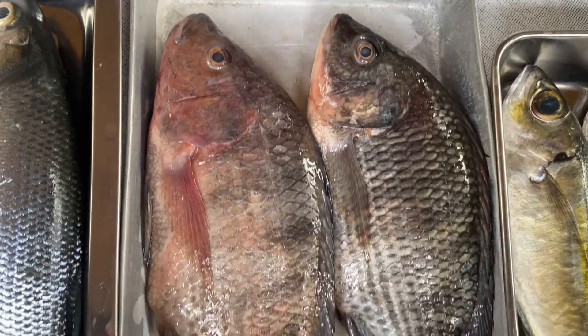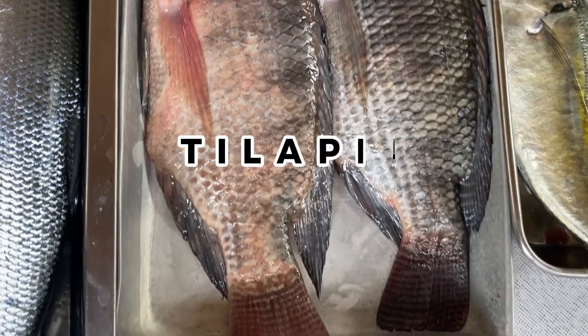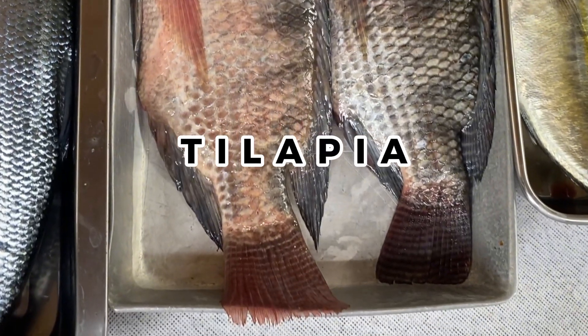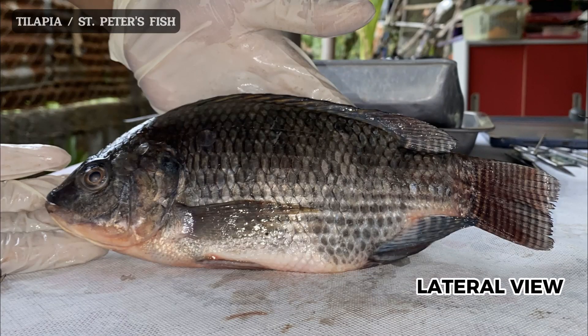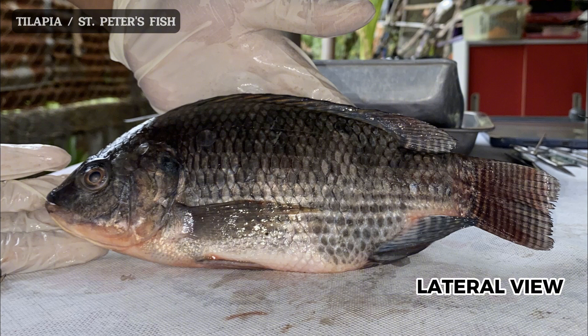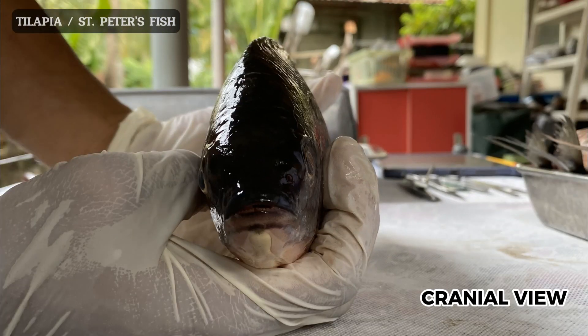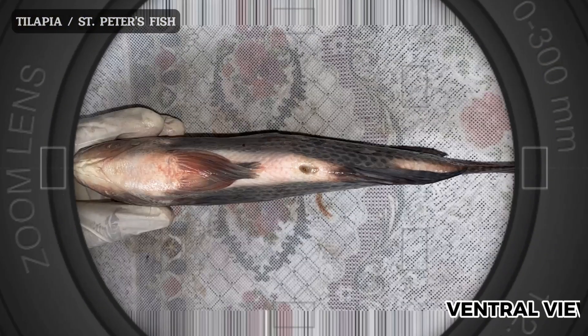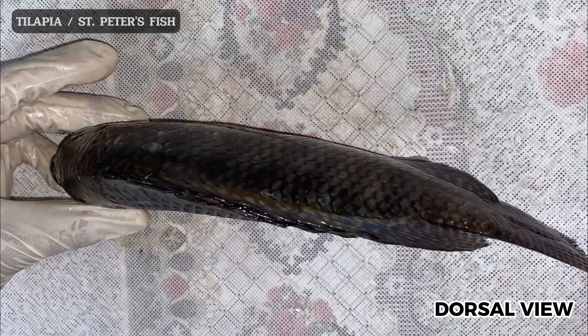For the next part, we will use the tilapia, also known as St. Peter's fish, as the model. First, we will view it in lateral view, then cranial, then ventral, and finally dorsal.